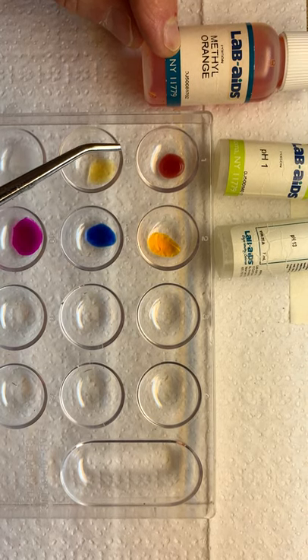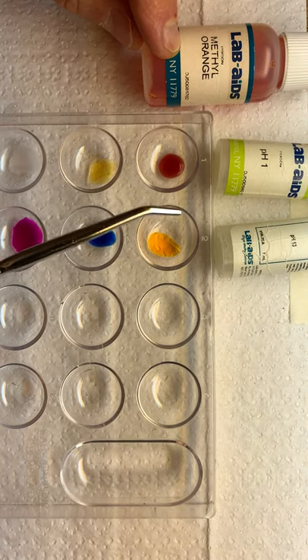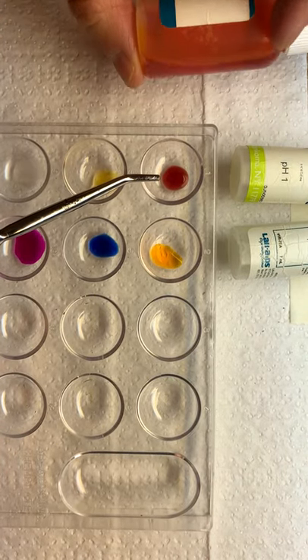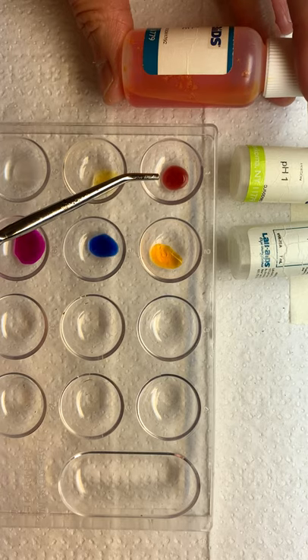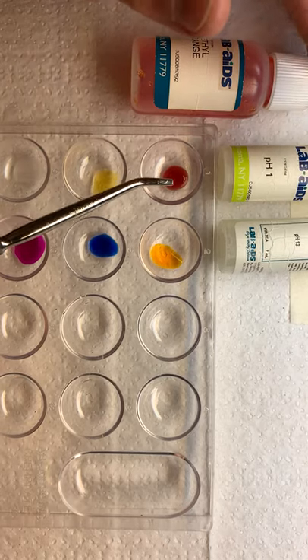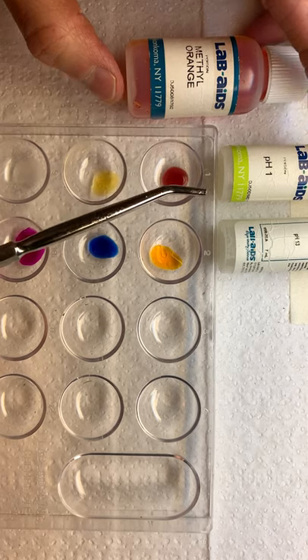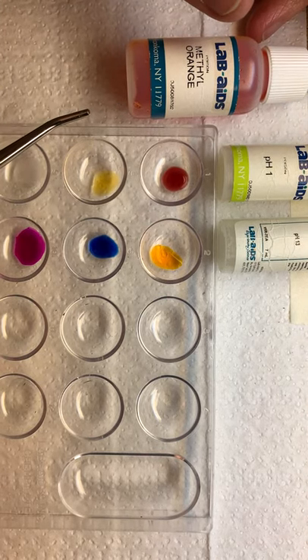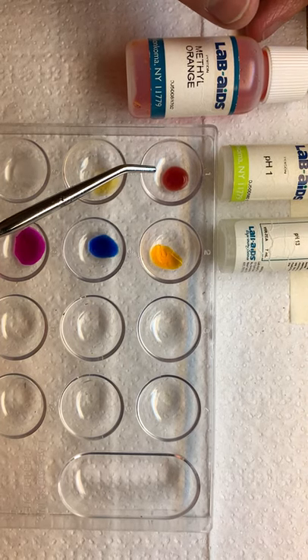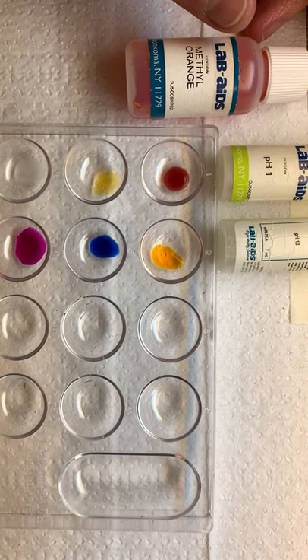Methyl orange changed to what color in pH 1? If you said red, you're correct. So in the presence of pH 1, methyl orange changes to red. What do you know about pH 1? Is that an acid or a base? Right, it's an acid. So methyl orange changes to red in the presence of this acid at pH 1.